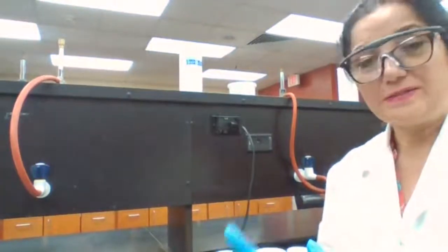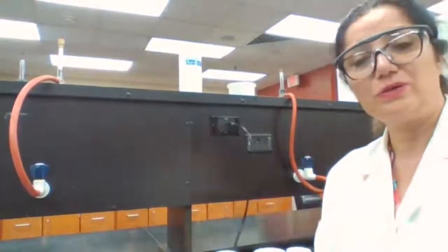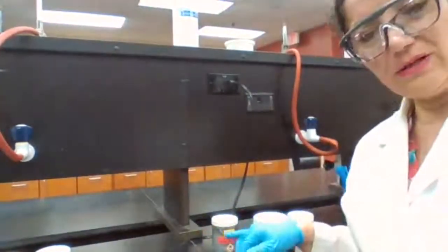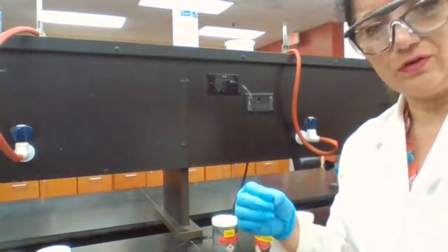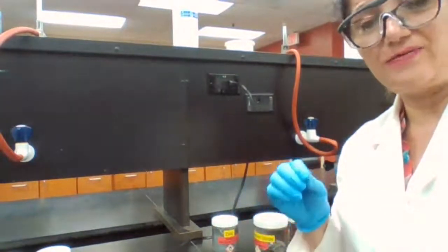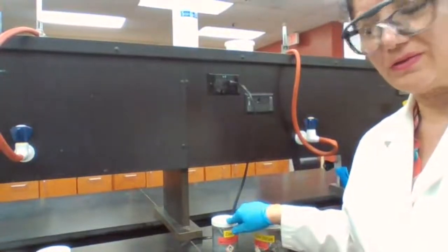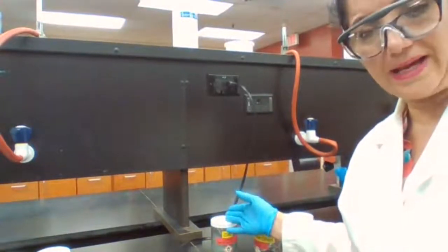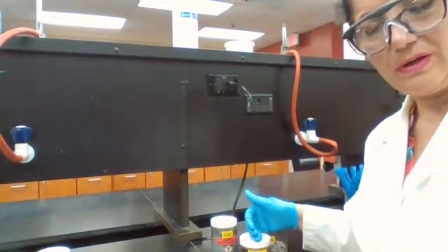Now, for this part of the procedure, we are going to make all three of them, separately in three separate test tubes, react with 1 molar HCl. HCl plus metal, if it reacts, would give hydrogen gas. So you would see bubbles forming. The faster the bubbles form, the faster the reaction, and that translates to the element being more reactive. So for example, if zinc forms much faster bubbles, that means zinc is more reactive. If copper forms much faster bubbles, that means copper is more reactive.